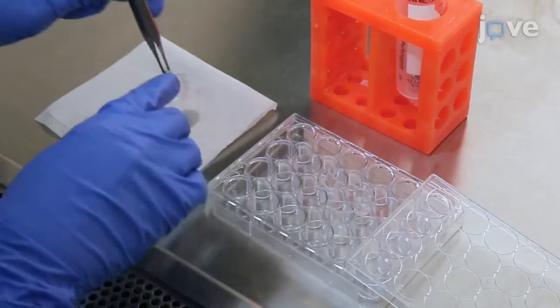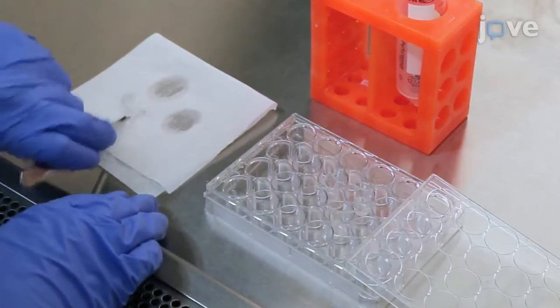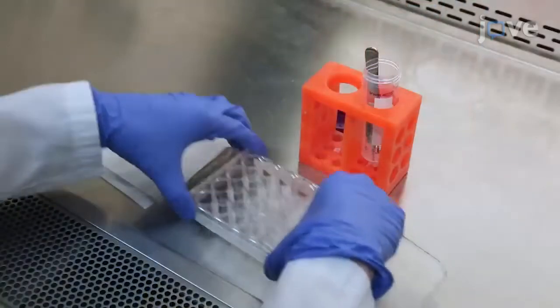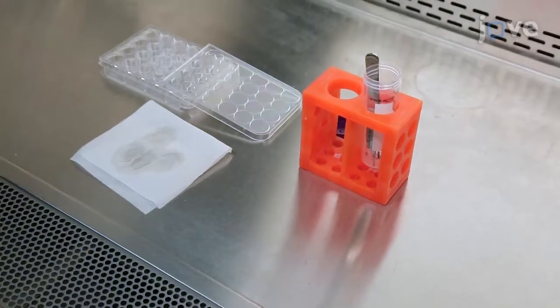Using sterile tweezers, invert each transwell to gently remove remaining solution. Allow the membranes to air dry in the hood with the lid open while cells are being collected.